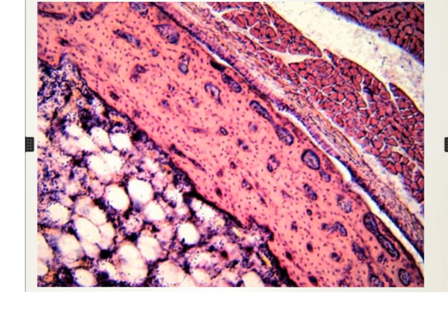In this photo, you can diagnose transversely cut skeletal muscle fibers attached to the surface of the bone, while this ribbon here is formed of the decalcified compact bone.